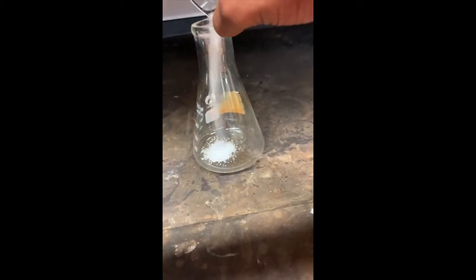We're in a vent hood to keep the fumes from coming out and basically suffocating us. Here we go — we're going to add the salt into the sulfuric acid. Can you see that? Oh, look at that — it's bubbling. Seems to be bubbling and doing a bunch. I hope y'all can hear the hissing. Stir it up a little bit. Look at that.